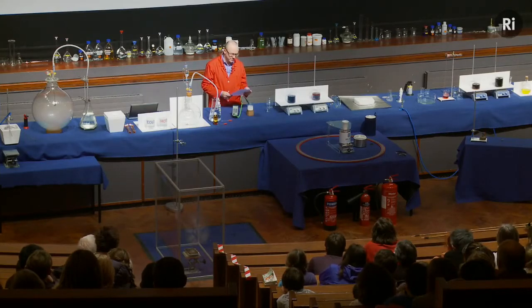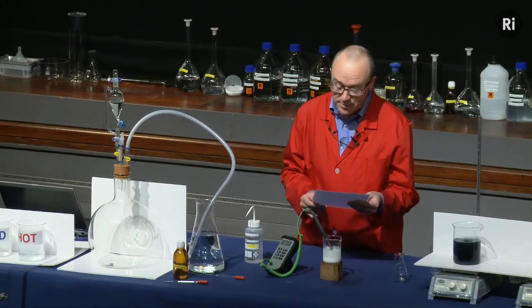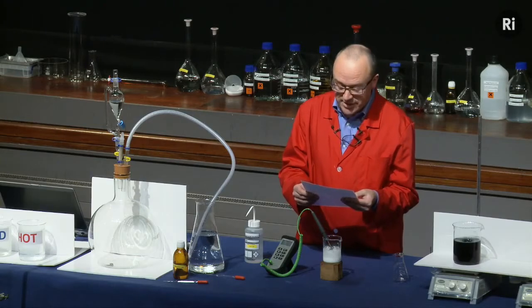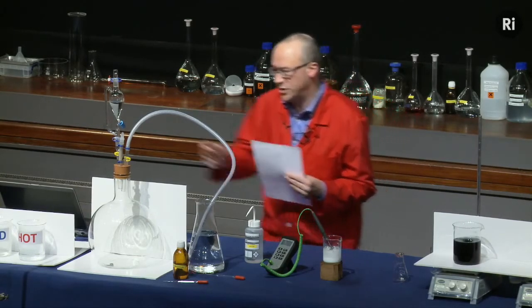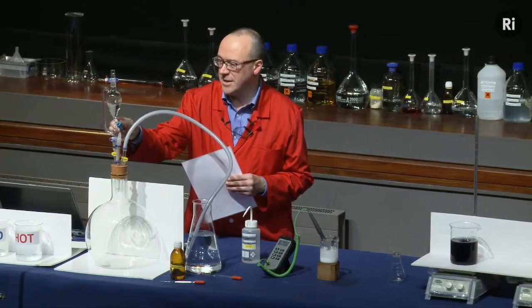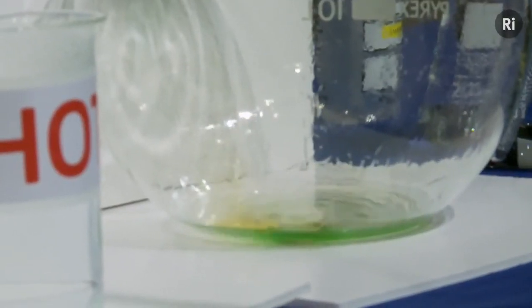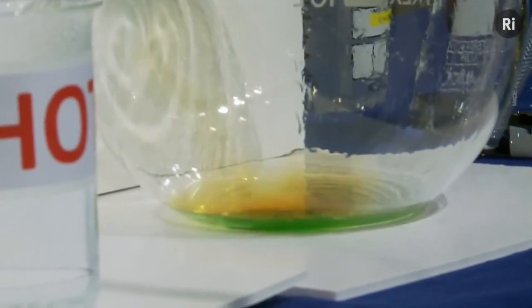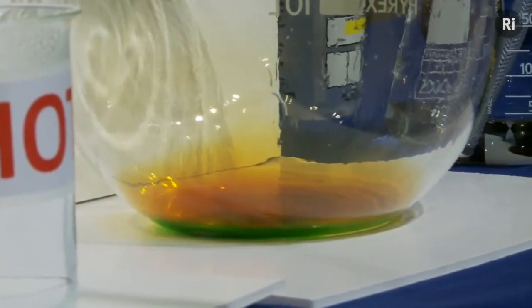All was still. In the interest of knowledge, I was even willing to sacrifice one of the few copper cents then in my possession. I put one of them on the table, opened the bottle marked nitric acid, poured some of the liquid on the copper, and prepared to make an observation. So let's add the nitric acid to the copper and see what happens. I think you can see that quite a vigorous reaction is taking place. We've got some sort of green liquid, it's bubbling away, some fumes are coming off.